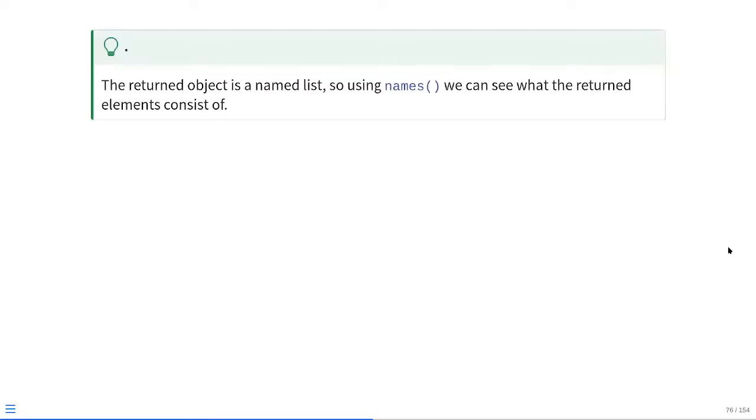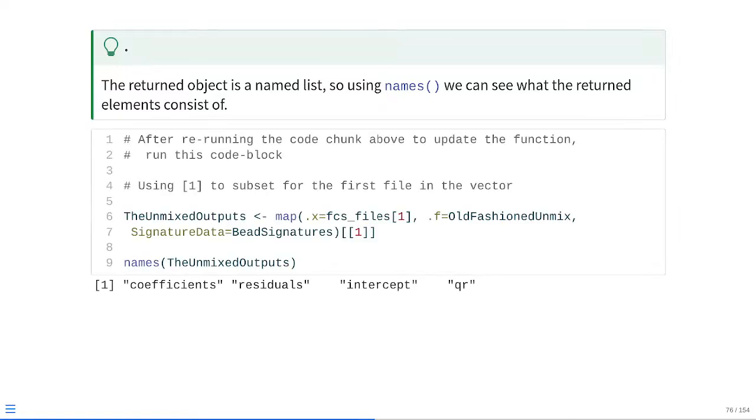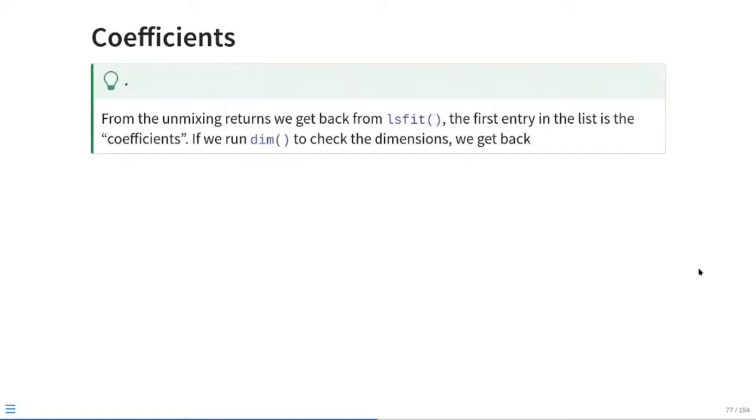So we get back a named list. If you may remember, we can use the names function to see what the individual items of the list are. So let's go ahead and do that. For that very first one, we can see we get back coefficients, residuals, intercept, and QR as different parts of the named list. So let's check these sequentially. Within lsfit's named list return, the very first entry is the coefficients. If we run the dim function, we get back the following.